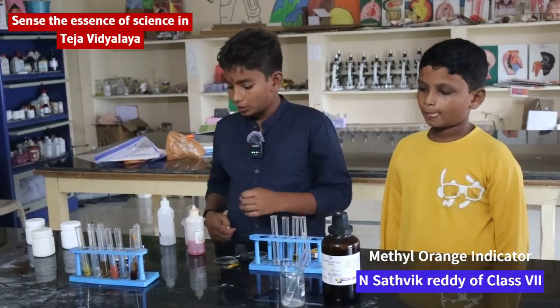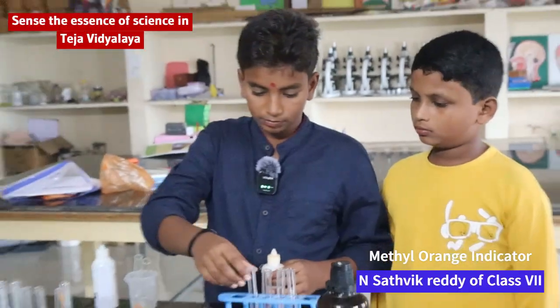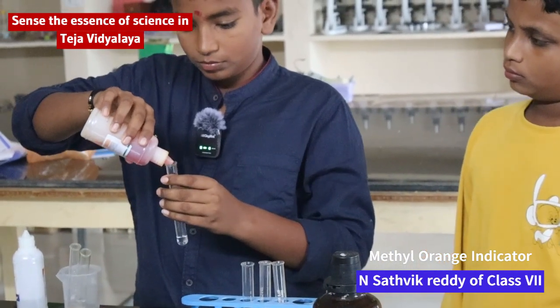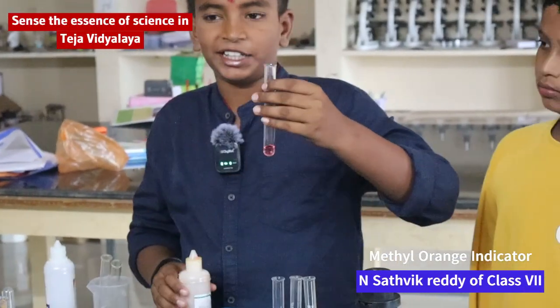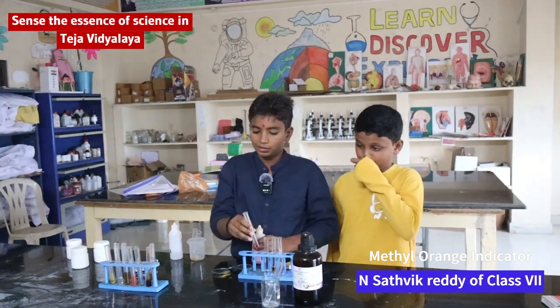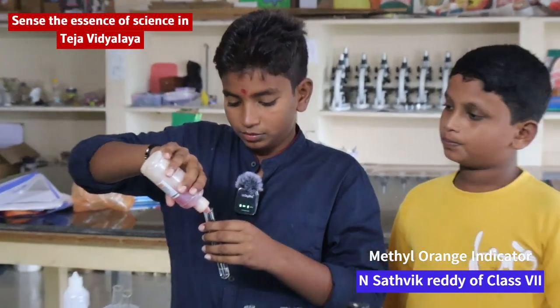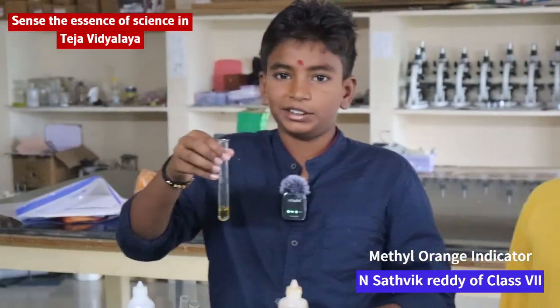Now I am telling about methyl orange indicator to find acid or base. Red color means it is acid. It changes to yellow color means it is a base.